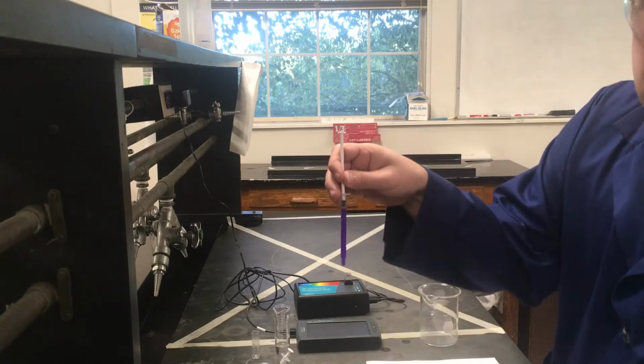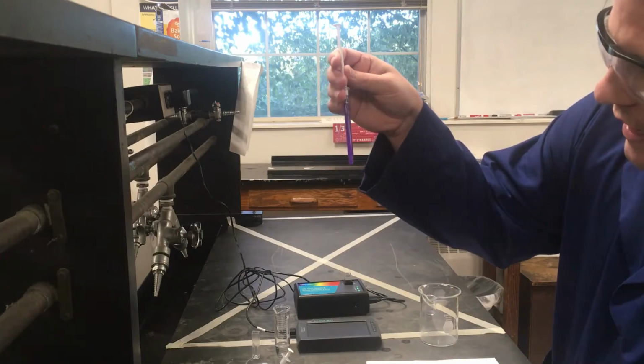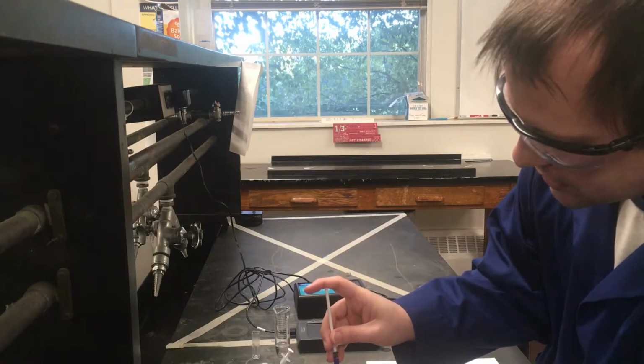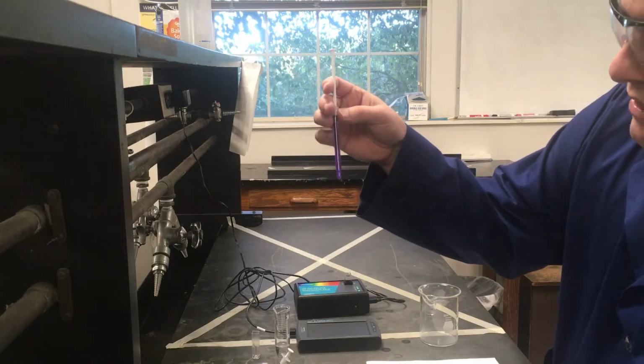There's a tiny little air bubble. That's not that big a deal because we see exactly where the liquid's at. I have the liquid at the actual maximum right now. It's maybe just a touch over, so I can get rid of just a tiny bit to get to exactly 1 milliliter of liquid in the syringe.